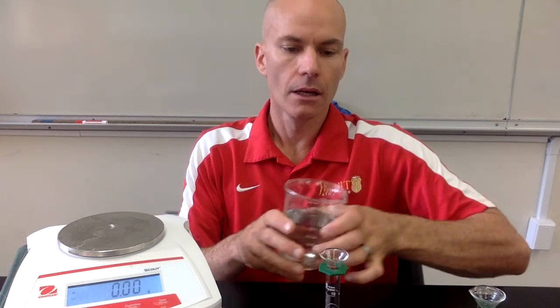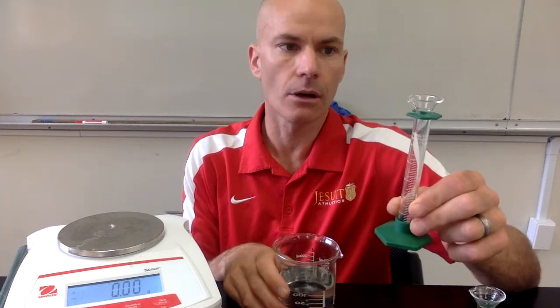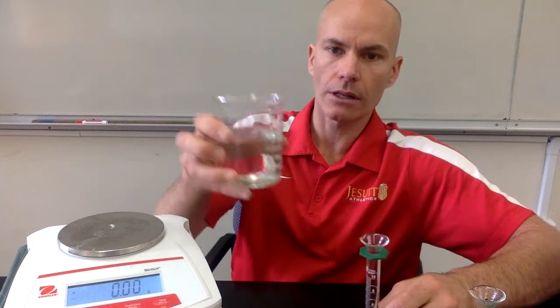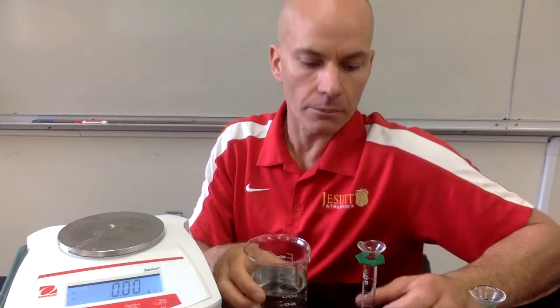All right, guys, in this video, we're going to be looking at the densities of solids and liquids to help you out to collect some lab data. So the equipment we're going to be using today, I've got an electronic balance right here. I've got some small graduated cylinders. I've got some beakers. I've got some different liquids and some solids as well.